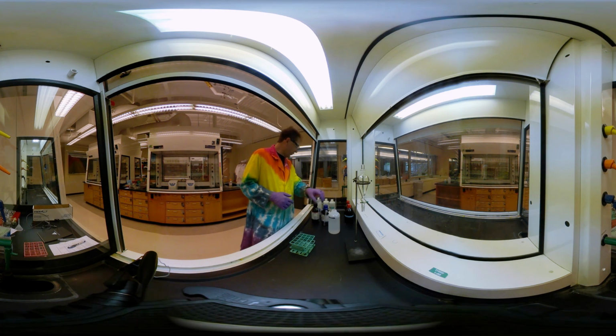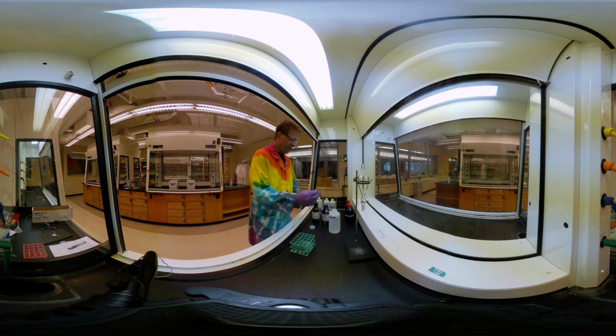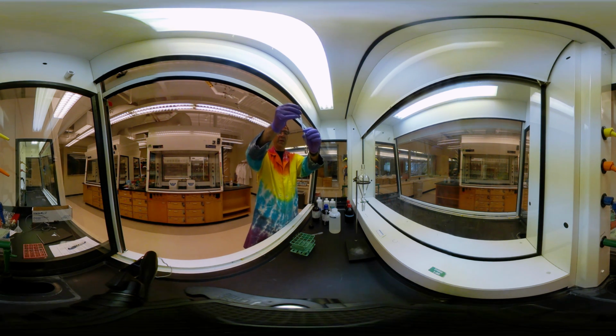So we're going to go ahead and start with our water. And let me go ahead and get a pipette here. Okay, and so I'm just going to put about 2 milliliters of water in here. Okay, then I'm going to add to this 2 milliliters of hexane. And so let's put our hexane in here. Okay, and I'll put it in so you can see it.